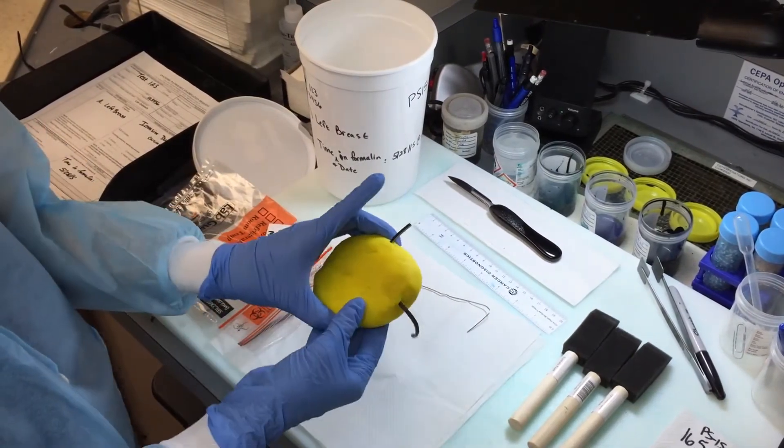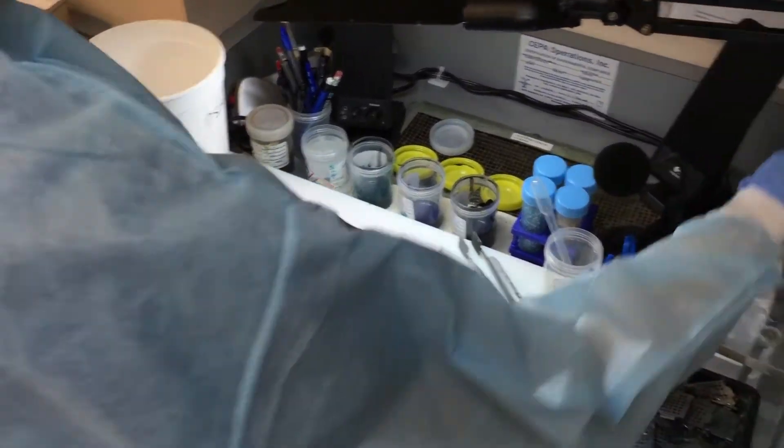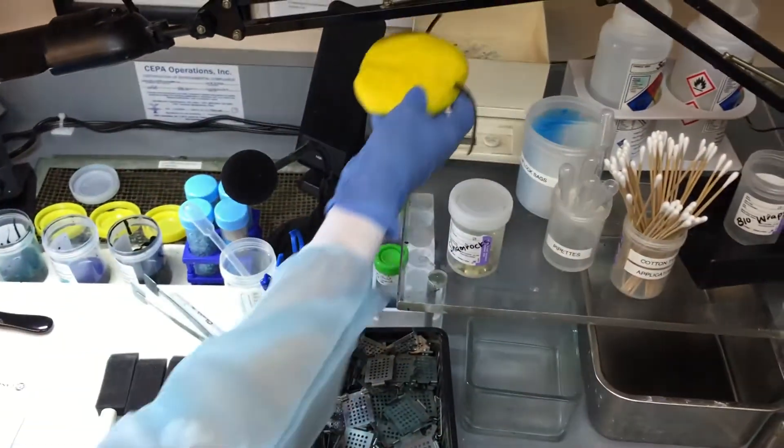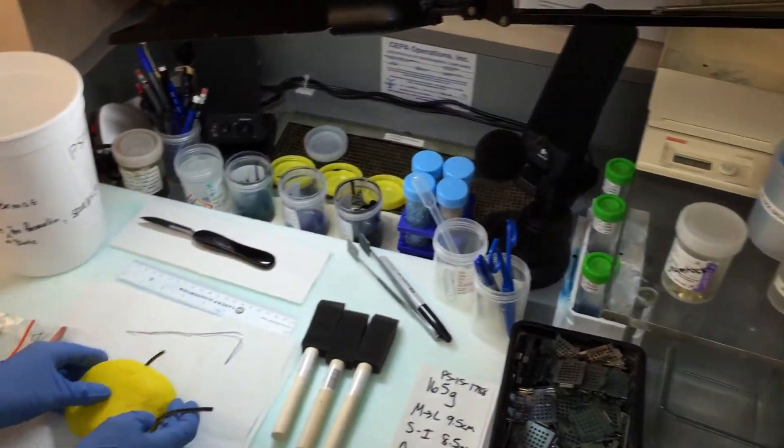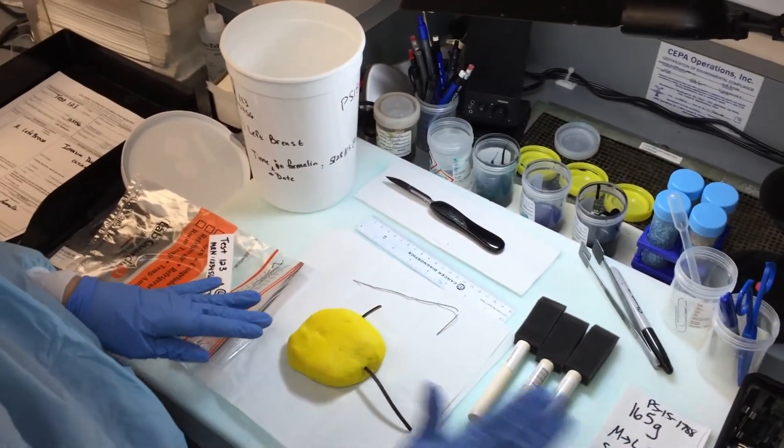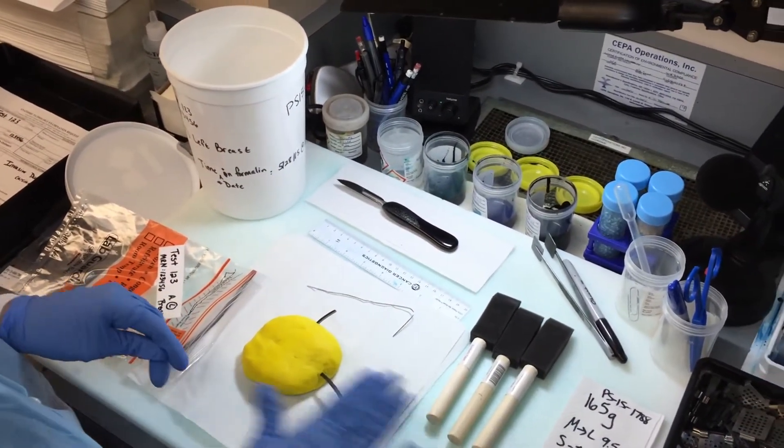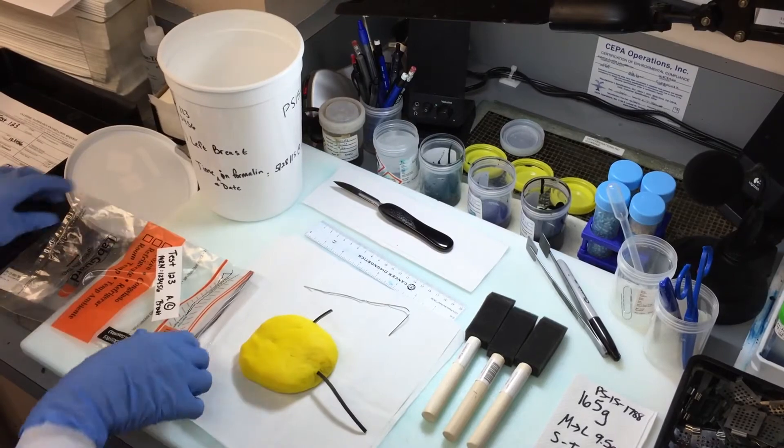So the next thing you want to do is weigh the tissue, which I'll put it up here. And it weighs 165 grams. So what I like to do is write these things down on the day one, so day two it is easier to dictate.